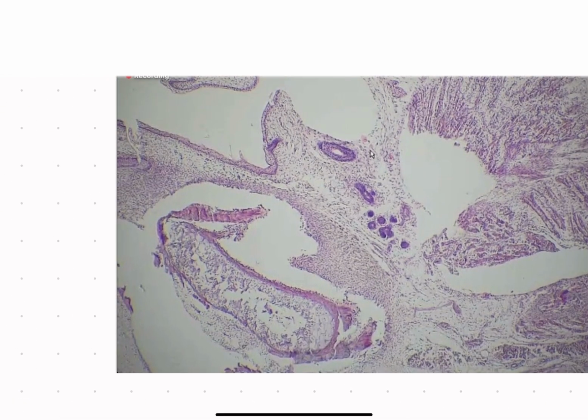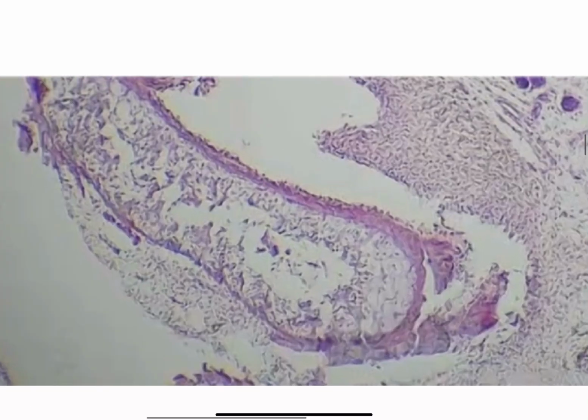Again, if we see a hyaline cartilage-like structure underneath the tongue within the lower jaw, the only two bony or ossification structures that we really can see is either the intramembranous ossification, which does not look like this, let me tell you that. It looks more like a zebra pattern or zebra stripy pattern. Or we can see a hyaline cartilage-like structure, which is the Meckel's cartilage, if it's within the lower jaw.